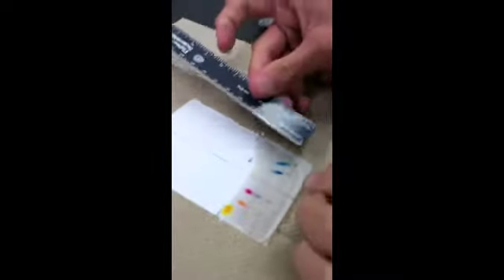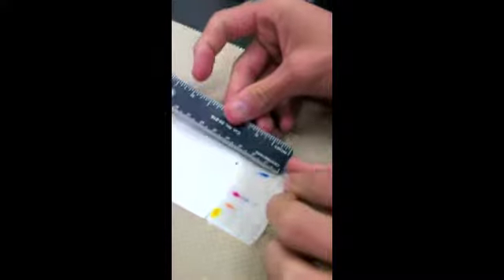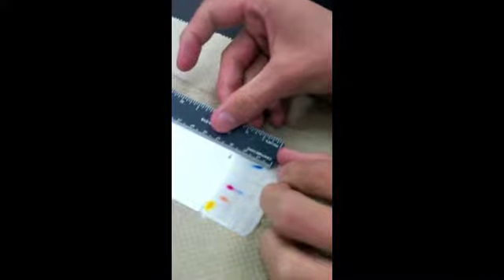While doing this lab, we made sure that our solvent was below the 1 centimeter mark on our TLC plate and waited at least 10 minutes or until the solvent reached 3 to 4 centimeters. Once I took the TLC plate out of the beaker, I immediately marked the line, and I'll measure this line to see how far it went up, which is 2.6 centimeters.